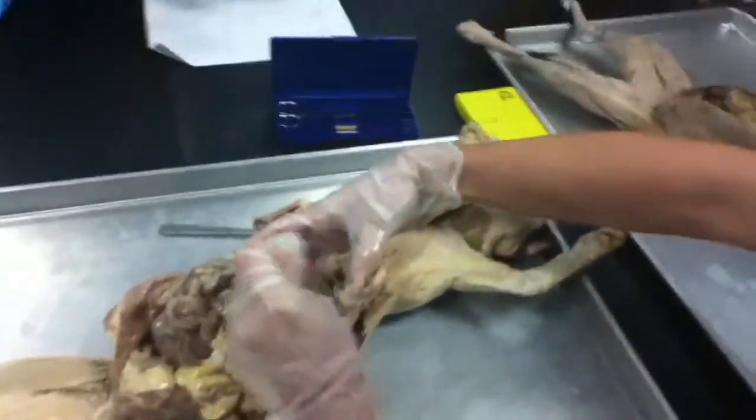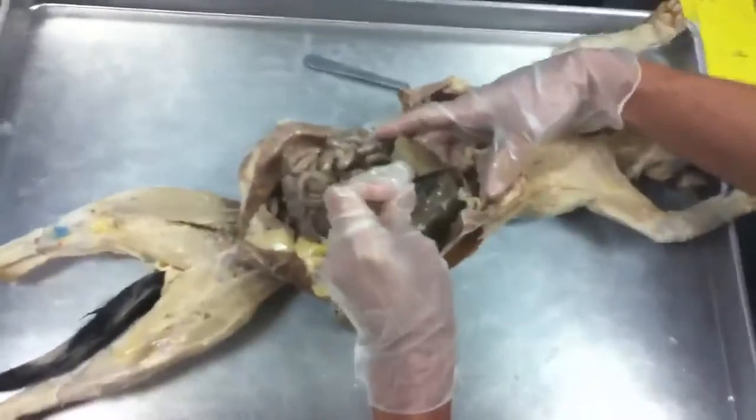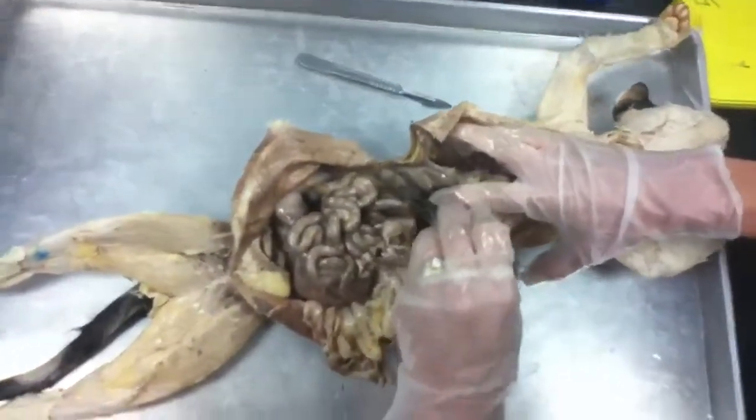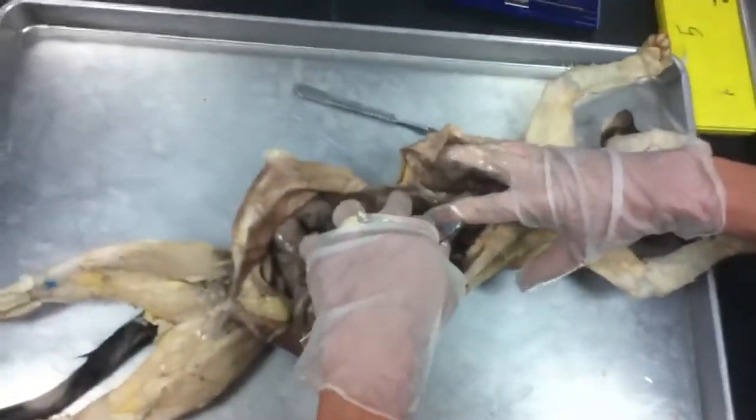It's really, really big. Okay. This one is going to be right, and since it's towards the middle, it is medial. And then the right laterals are actually these two that are over here on the side. Sometimes they're kind of buried in there and you have to dig for them a little bit, okay? So those are the right laterals.